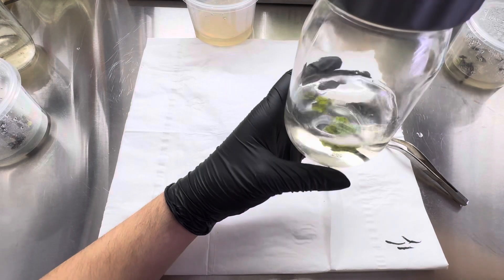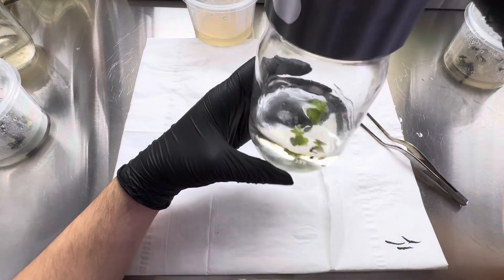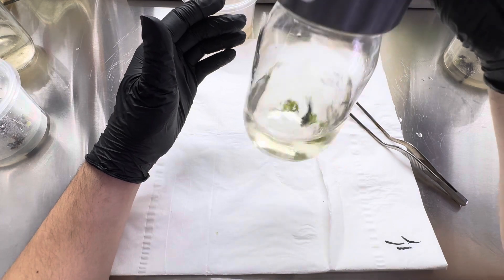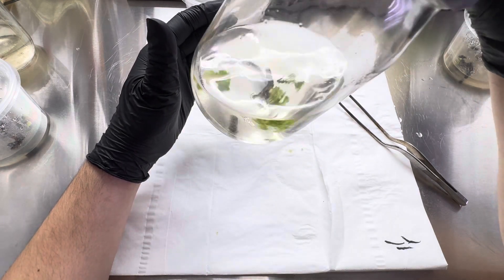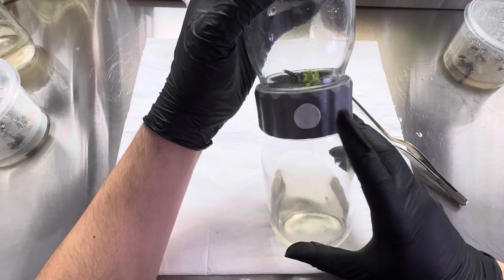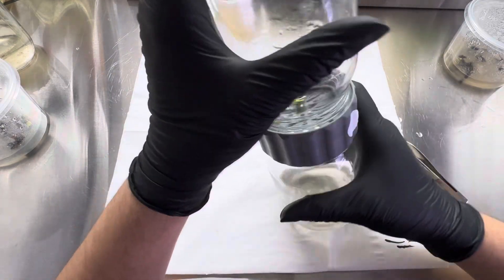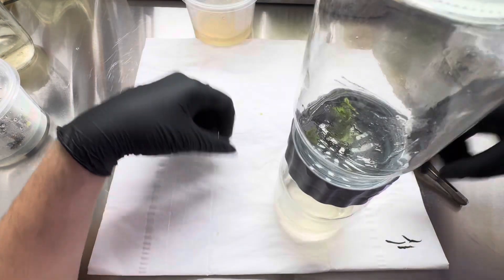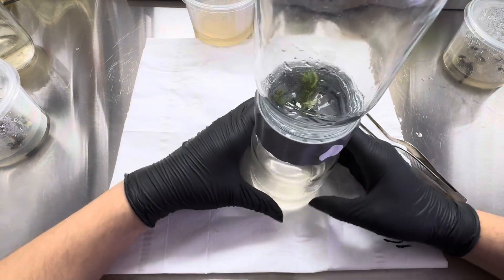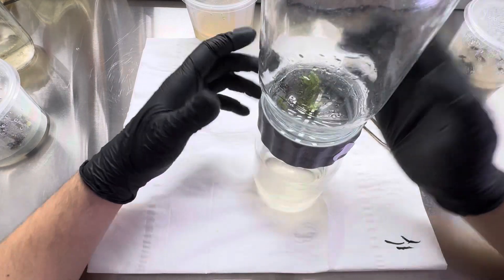This will be their first feed. I like to personally do this once a day. I'll flip it, give them a little swirl — nothing too aggressive — and then I always flip it on the opposite side of the filter so that you don't get any leaking, and then do a little tap, and that's it. Then this will go under some grow lights, and it should be good. It grows pretty quick — I'm a big fan of liquid culture.